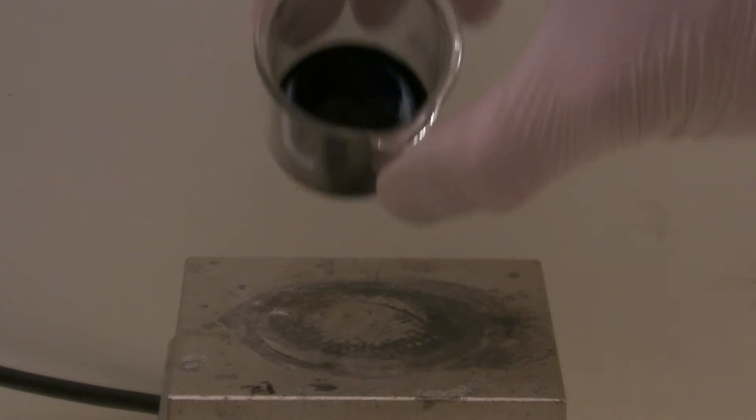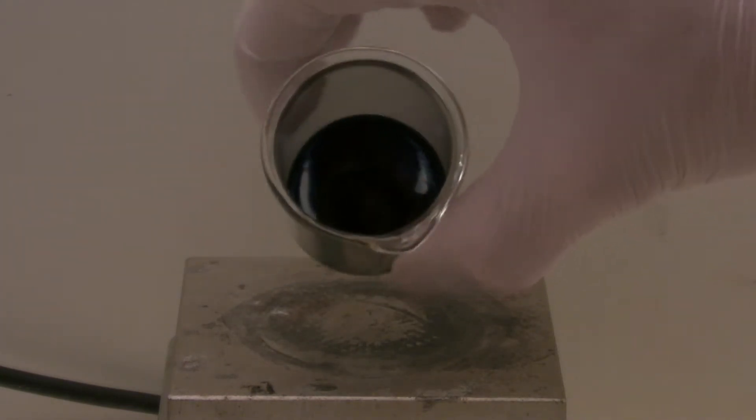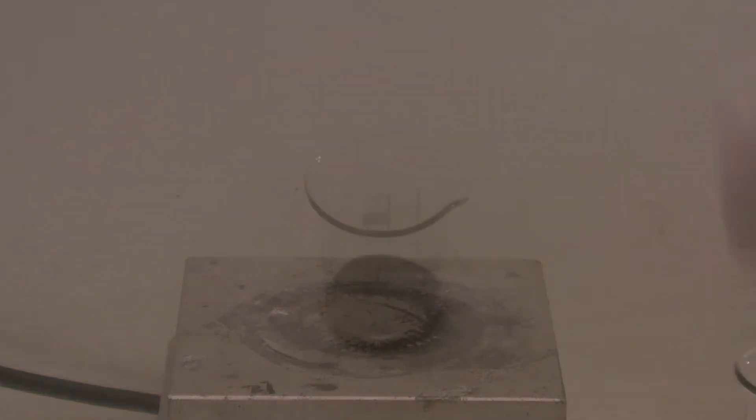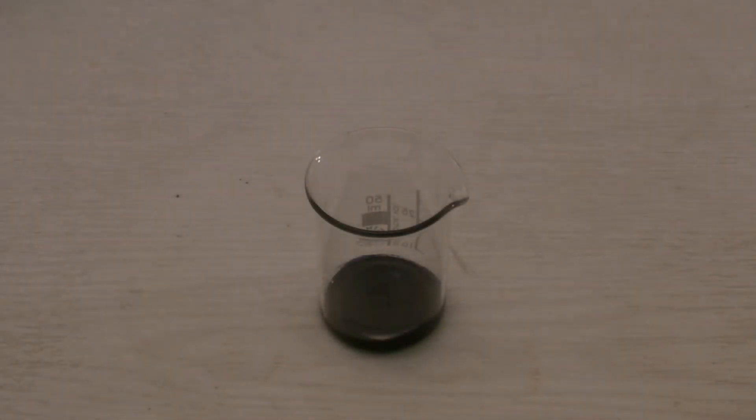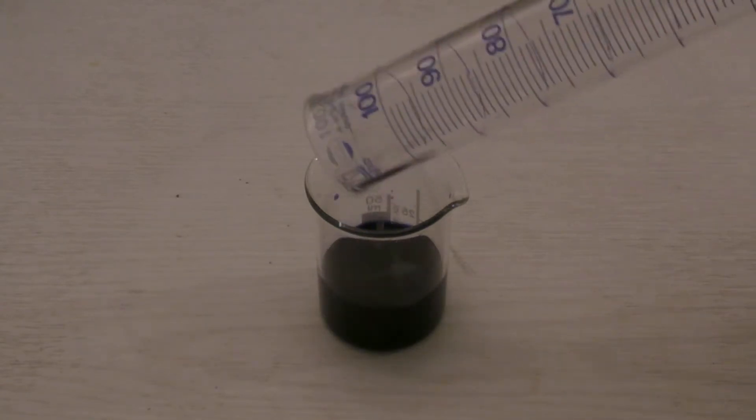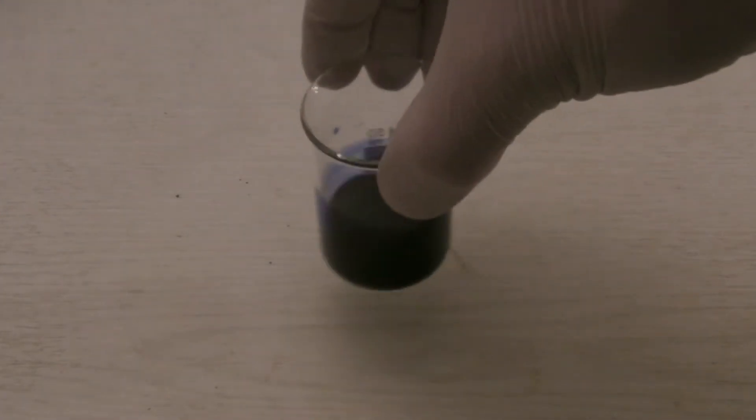After 10 minutes, the mixture had turned blue and was removed from the hot plate. Then the well-known rule was broken, because 20 milliliters of distilled water were added to the cooled down mixture of indigo and sulfuric acid. Due to the small scale, nothing should happen, but it should still be taken care. As it can be seen, the indigo was now water soluble, which is a sign that the sulfonation was successful.